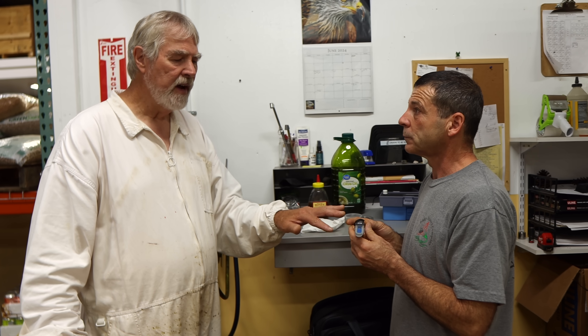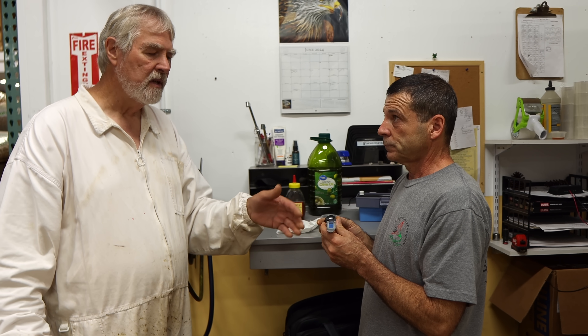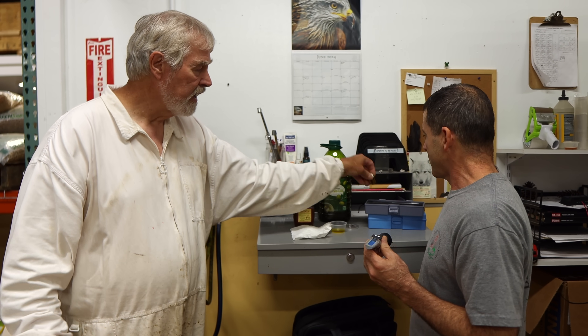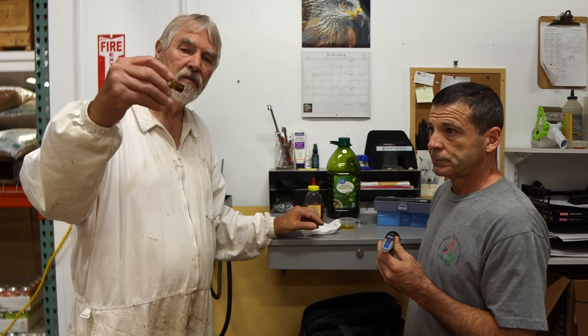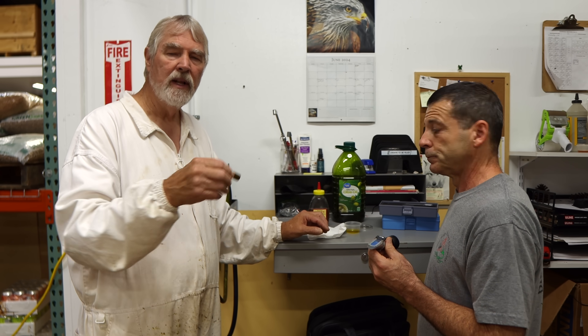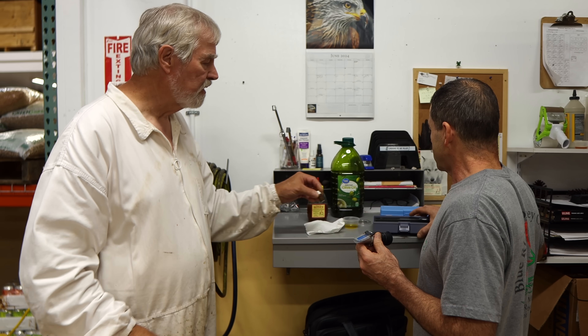That gets us within half a point. I haven't adjusted this month so I'd like to bring it back to 71.5. Not all refractometers give you that ability. Most of them honestly don't show the Brix scale, but this one happens to do that. That's one of the reasons we like this one and carry it in our store. These refractometers do come with a calibration fluid, but it runs out pretty quickly and we like the olive oil method — it really works, it's better.